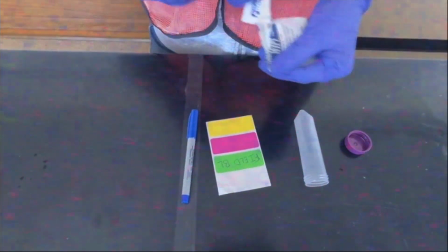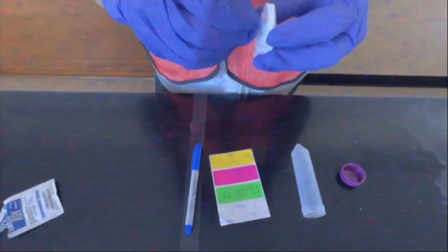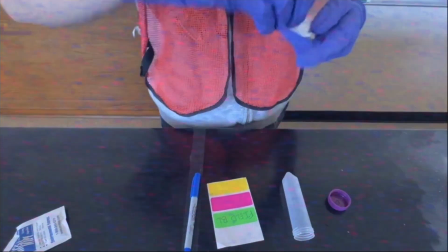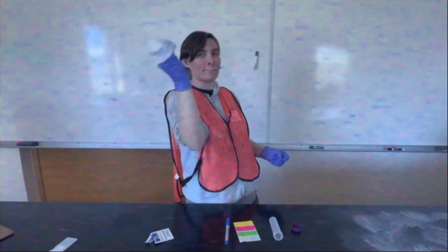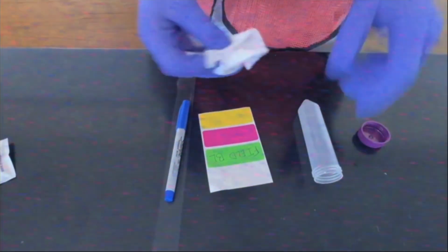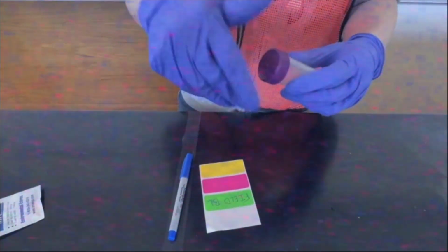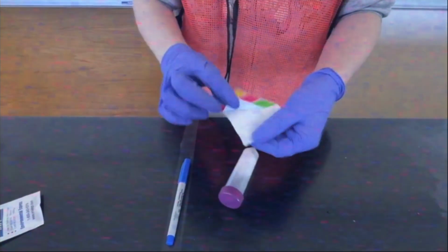This is a field blank. The field blank samples nothing, and yet it is important to collect the sample. Like a referee or a hall monitor, its purpose is to identify contamination introduced during handling. A noble responsibility.